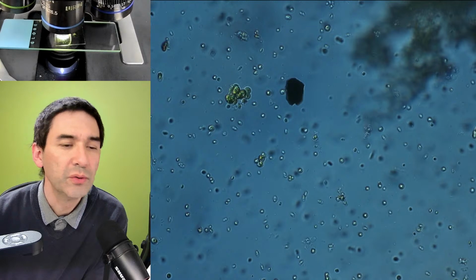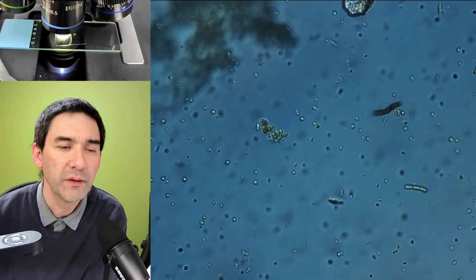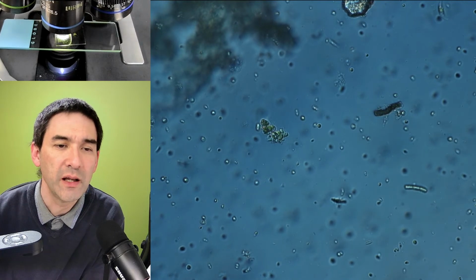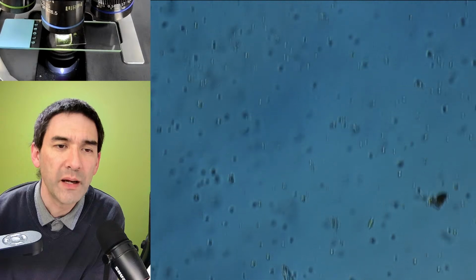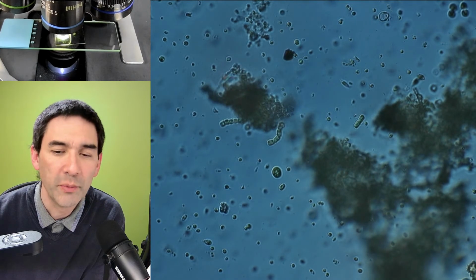So what I could do now is I'm just going to leave the jar standing, and usually you see some kind of a progression because the light is different, the temperature is different, and usually you might then see that other organisms start to become dominant over time.